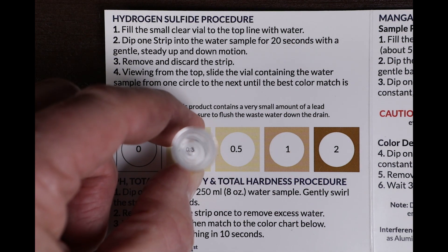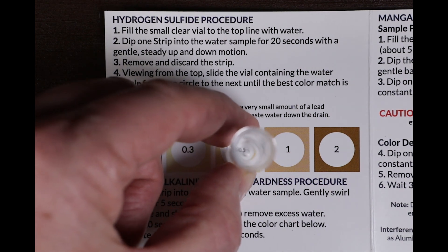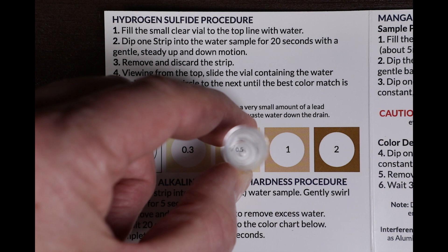Viewing from the top, slide the vial from one circle to the next until the best color match is found.